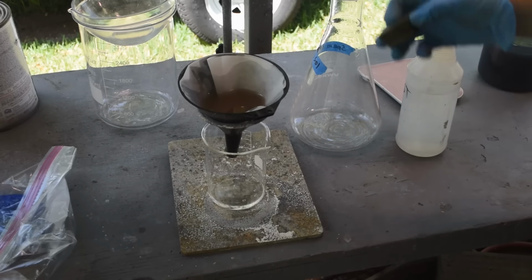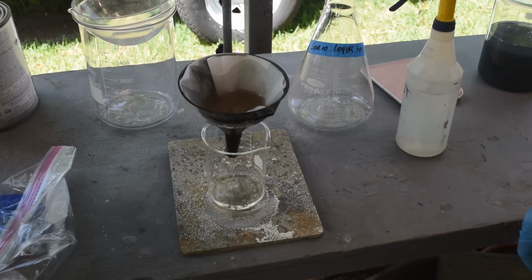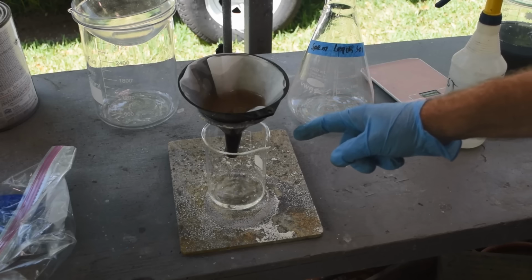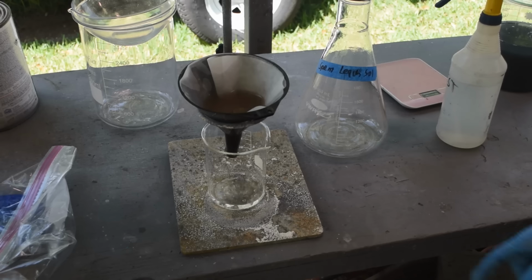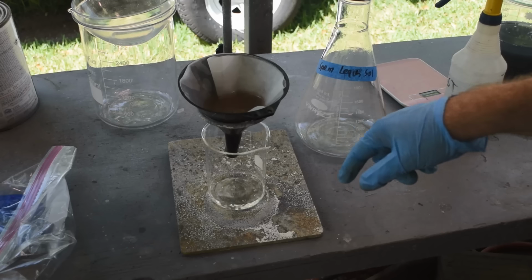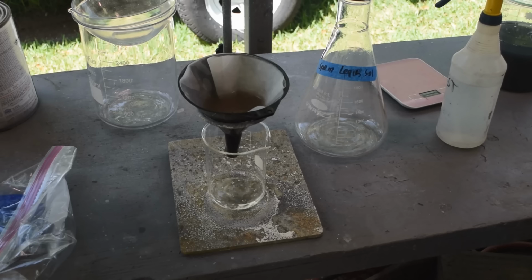Didn't get all of it out, but got most of it. There's definitely a scum of it on the sides of that flask. But if this does turn out to be gold, I can just run some aqua regia and swish it around in here and dissolve it. We'll see. So we'll let this filter through. I'll run some distilled water over the filter to get the leach out of it, and then we'll put that filter in aqua regia and see what we got.